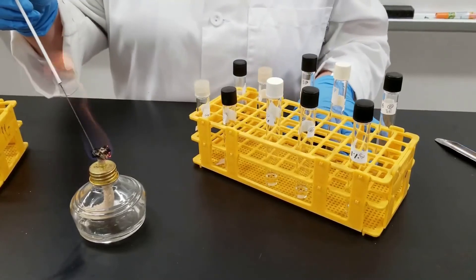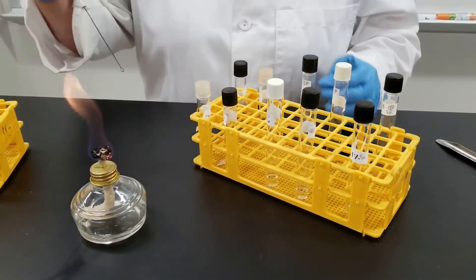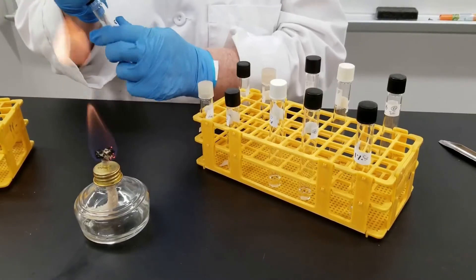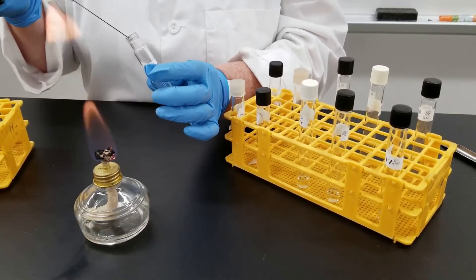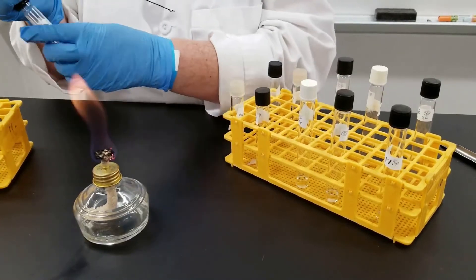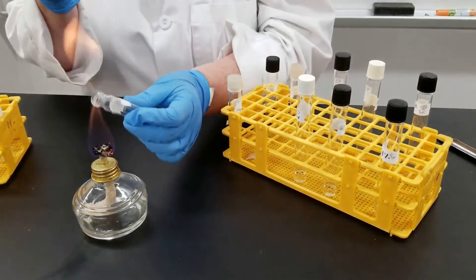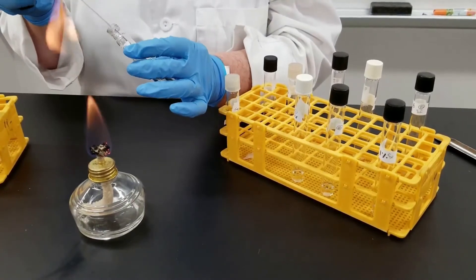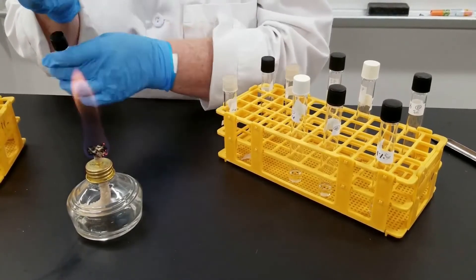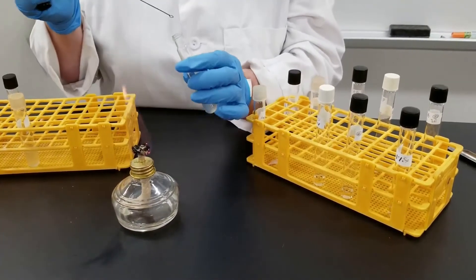We're simply going to inoculate. We have stock cultures growing in a nutrient broth, and we're just going to use that to inoculate the various tubes. We'll start with our control — the nutrient broth with no salt added whatsoever. The salt concentrations have already been added to the media when we were making it, so all we have to do is inoculate the tube just like we would any other. As I inoculate, I'm moving the tubes over to the other rack so I can keep track of which ones I have inoculated.